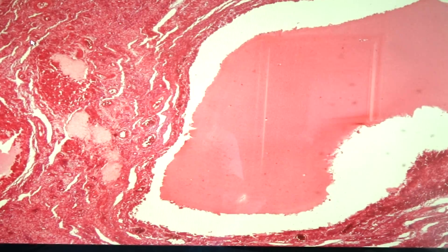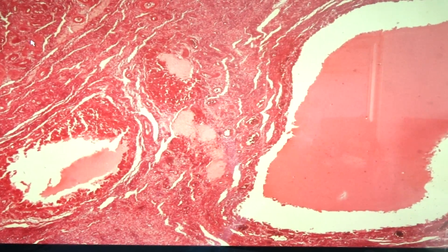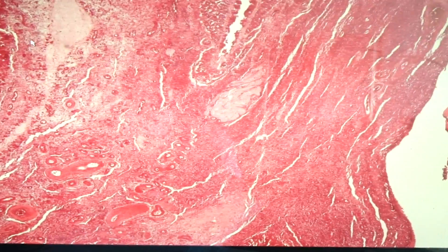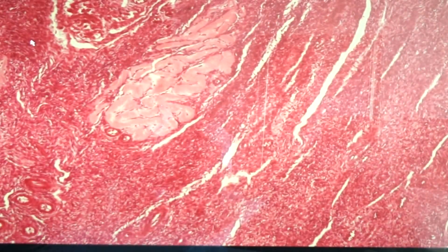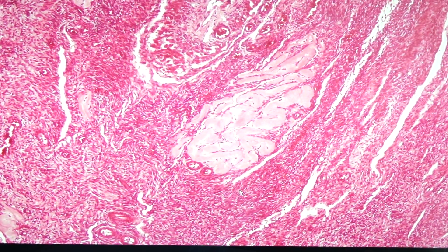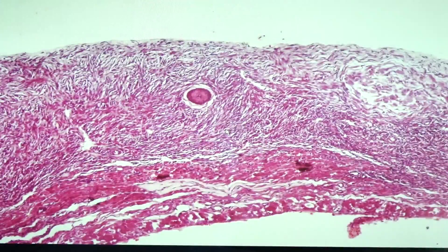I think this particular ovary was taken from a pregnant patient. We would also appreciate the presence of some remnants of ovulation which we would call as the corpus albicans. So let's start with the follicles.